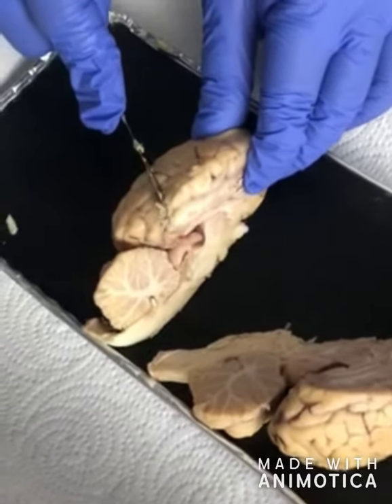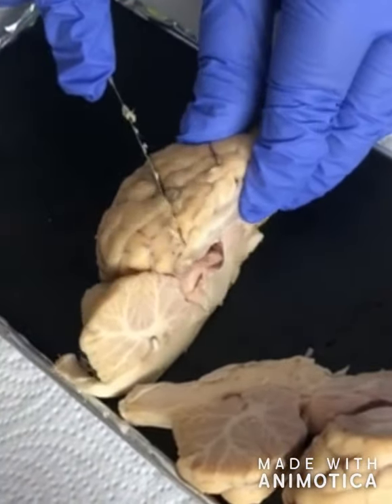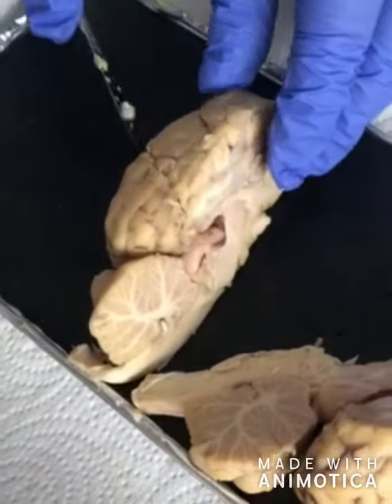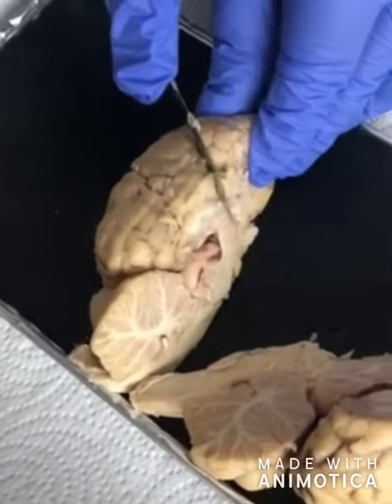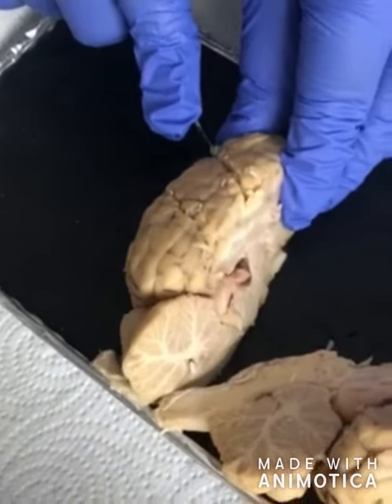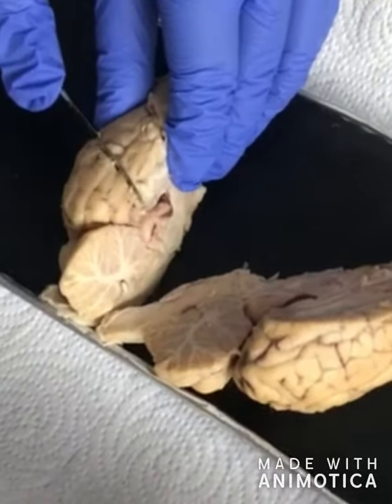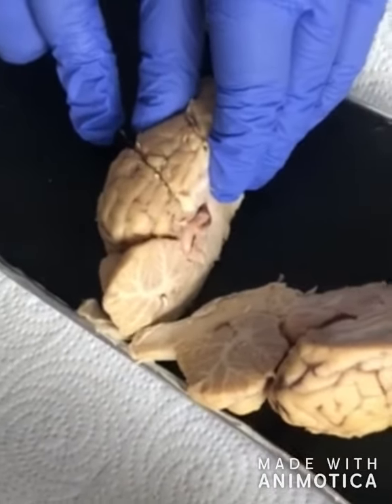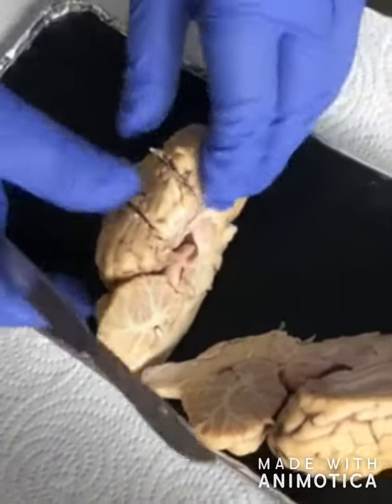Next, we are going to take a look at the tegmentum, which is located underneath the tectum. The tegmentum contains many neurons that play roles in many different functions. One role that it is seen to play is with reflexes, control of movement, and auditory. Next is the cerebral aqueduct. Its location is seen in the mesencephalon, connecting the 3rd ventricle to the 4th ventricle. It contains cerebral spinal fluid.